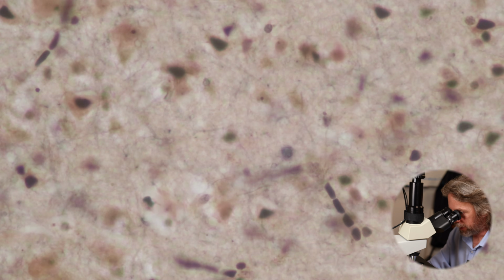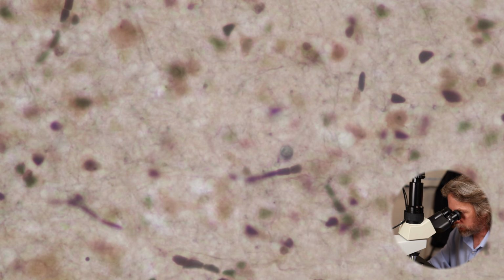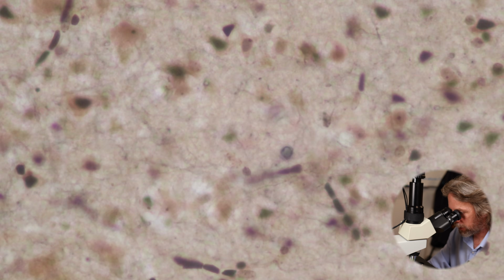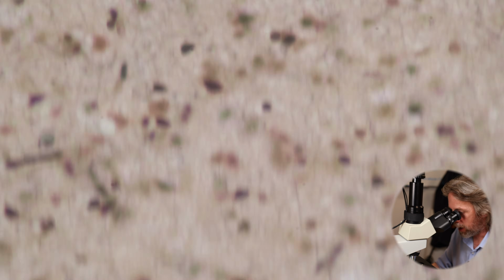Oh yeah, we've got quite a bit of thickness here. Look at that. You can see a triangular cell in the middle there, and then come back out to that one. Thickness doesn't really help when you're looking at histological sections, but it is required for some stains. So this is probably a few cells thick. Right, I'm just rambling now, aren't I? All right, let's go back out again.